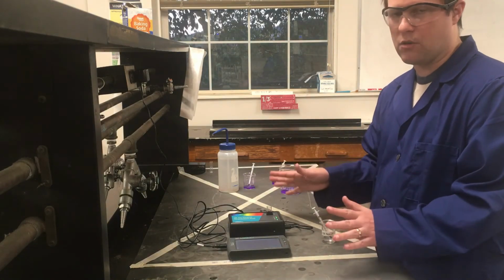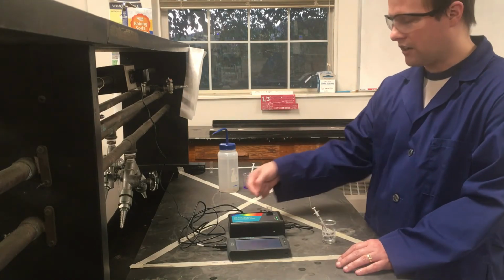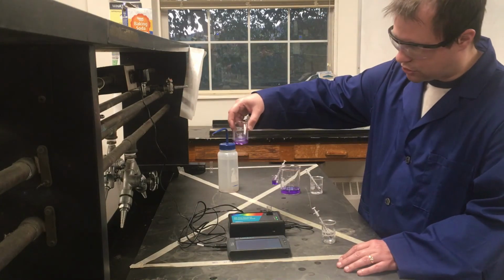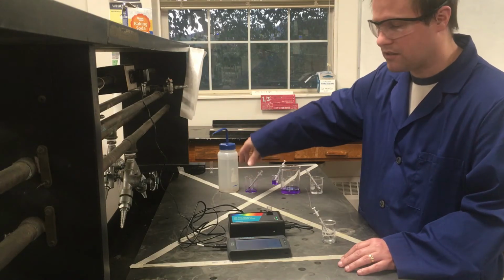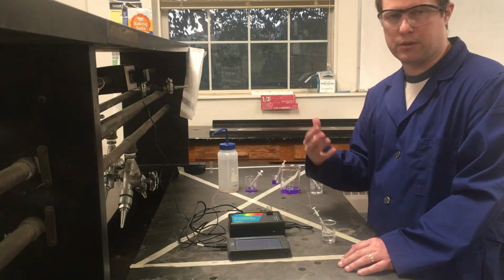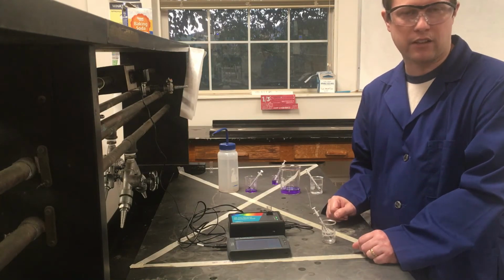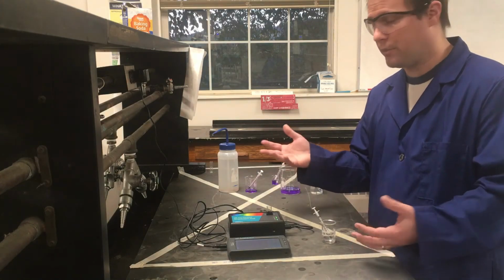And again, like I said, I'm not going to make you watch the whole 10 minutes, but in the next clip of the video that we're going to look at, I'll give you a view of what this looks like for its color. Remember, it started out looking like this in terms of its actual darkness. And so I'll compare to this at the end of our 10 minutes so that you can see what it actually looks like. And then I'll present at that point a lot of the data that you're going to need. I'll probably show it in an Excel spreadsheet form that you're likely to get the file in, so you know what you're going to be doing for the calculations. But that pretty much should be it from the experiment standpoint.